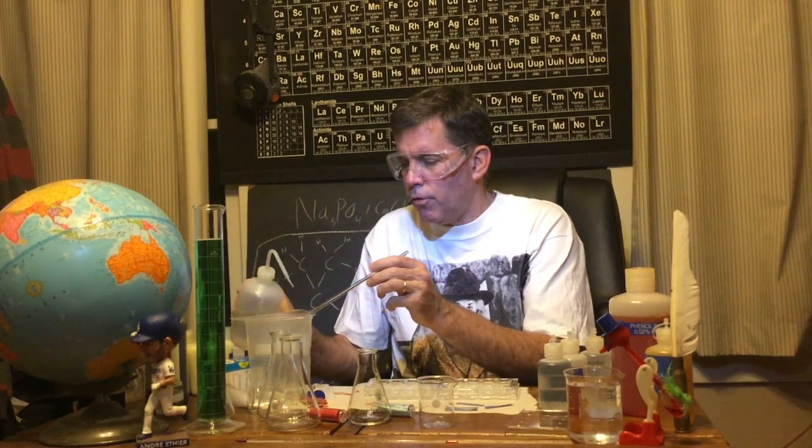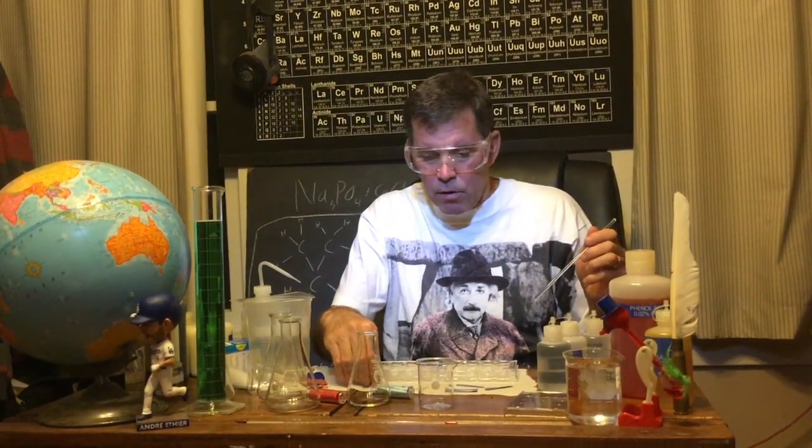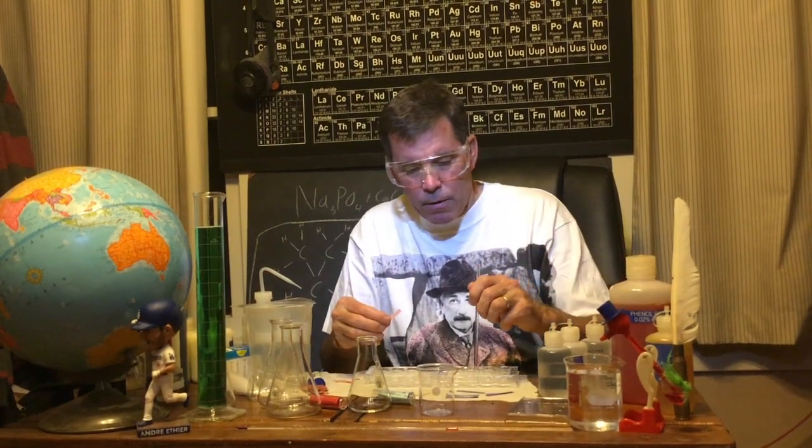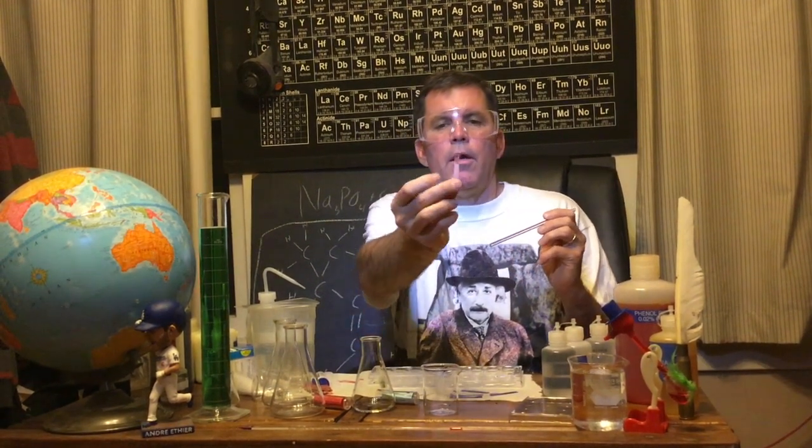You're probably not too excited about those observations. Well, let's try sodium chloride on that same paper. Is sodium chloride an acid? Is it a base?